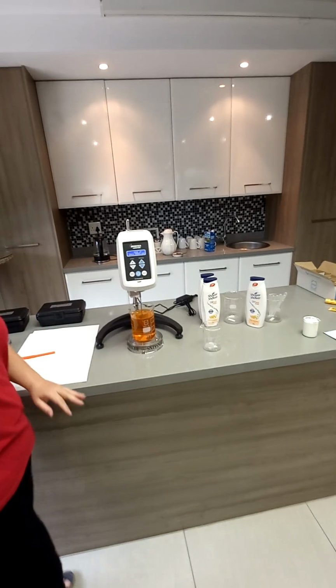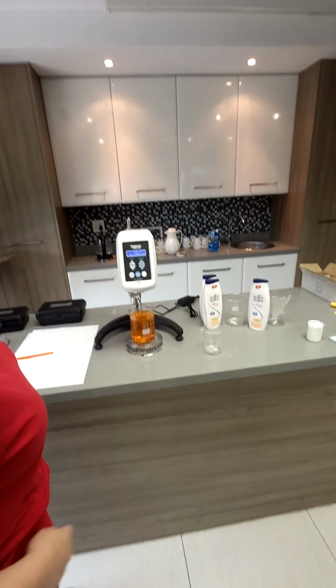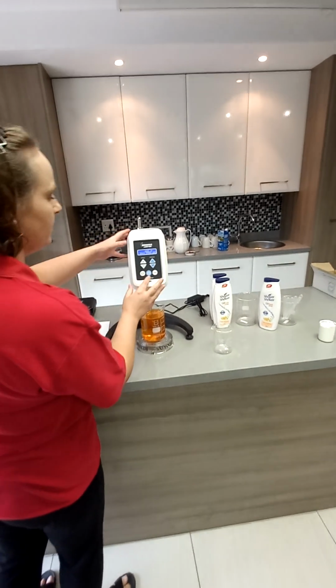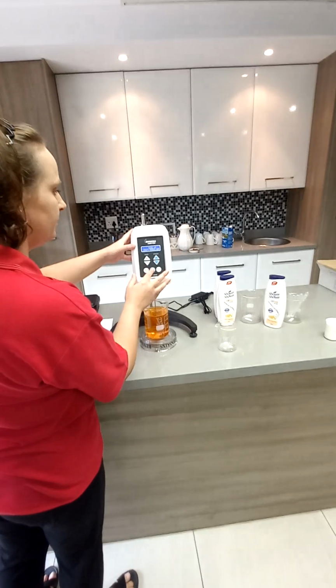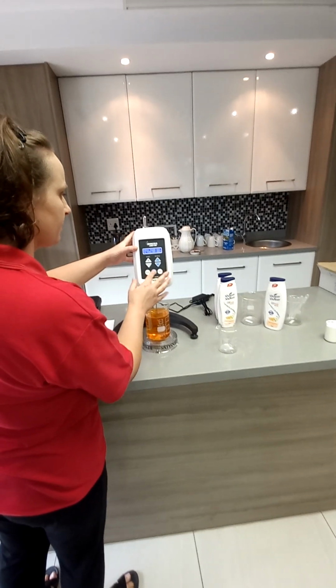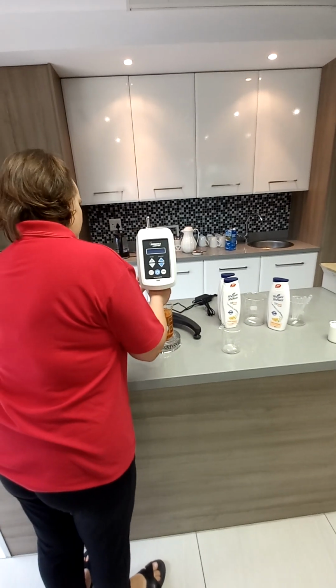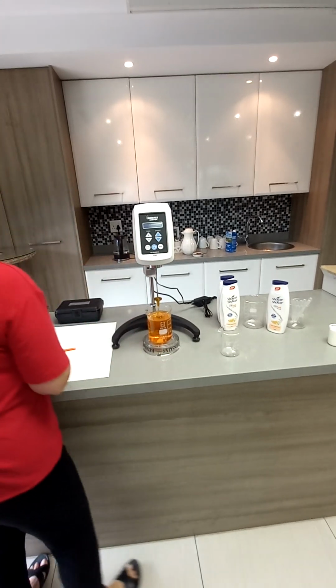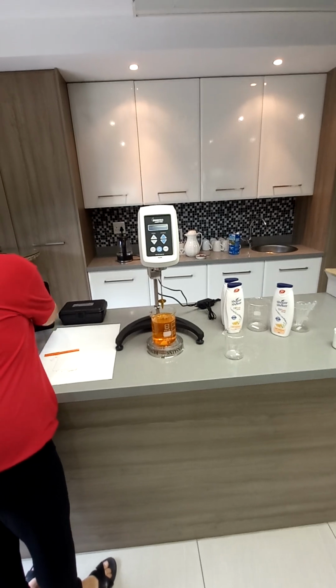So the viscometers come in three ranges for every model. The LV is for the low viscosity sample, so the spring is specific to that LV model. Then you get an RV, which is a mid-range, and then an HA or HV, which is higher viscosity. So you have to select the viscometer according to your sample range. Okay, that makes sense.